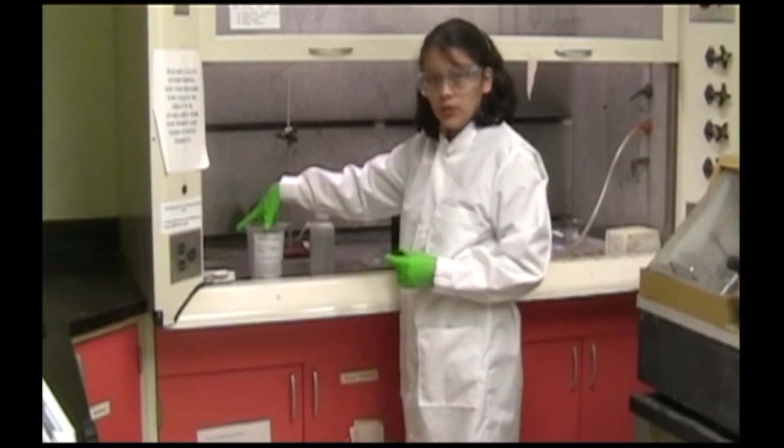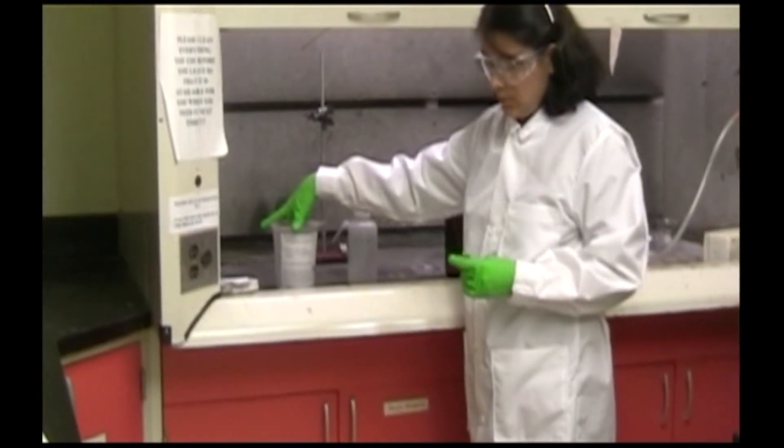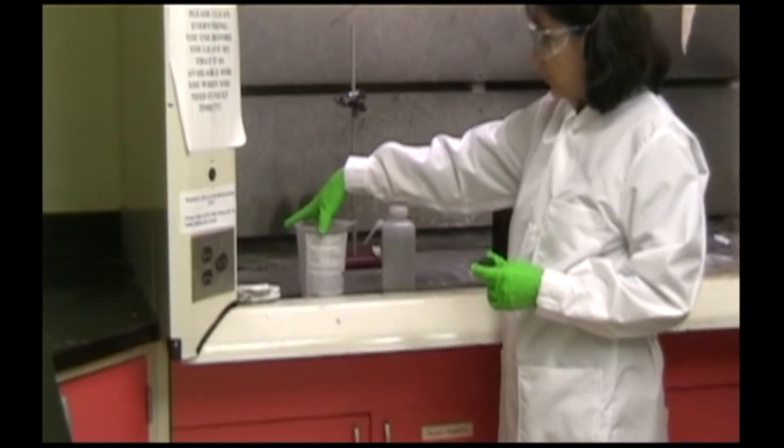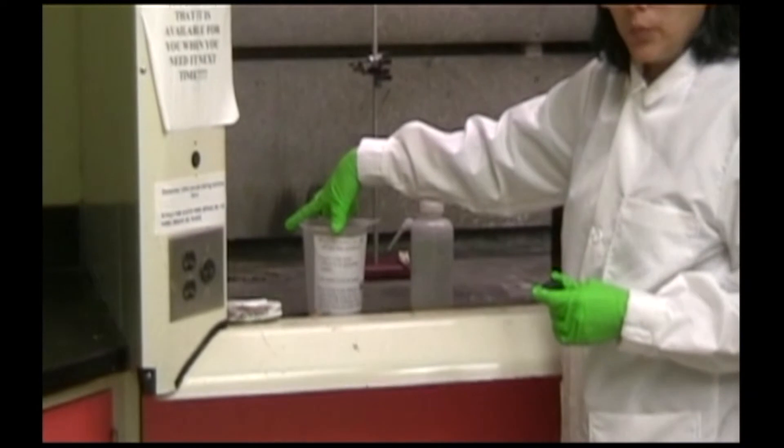Once you have finished etching your specimen, you need to dispose of the waste effluent in an appropriate manner.